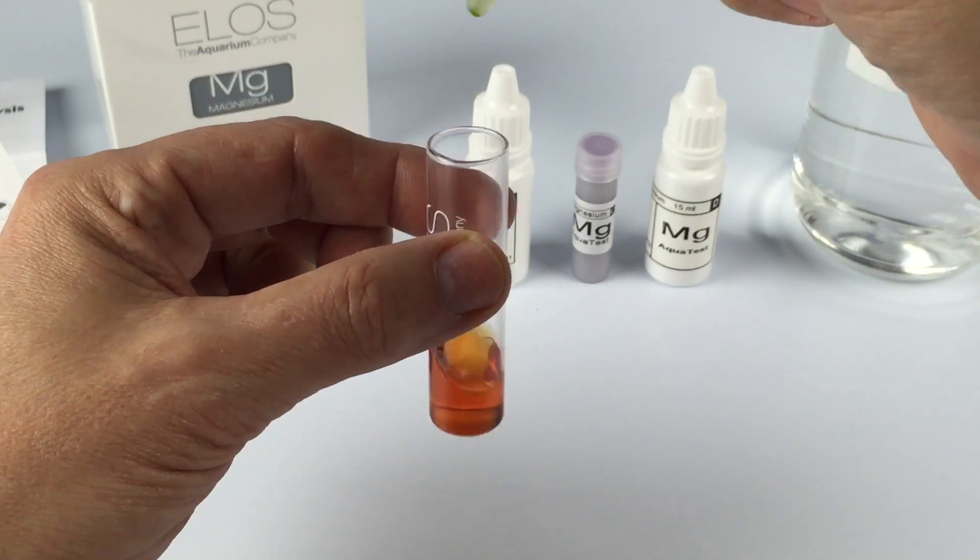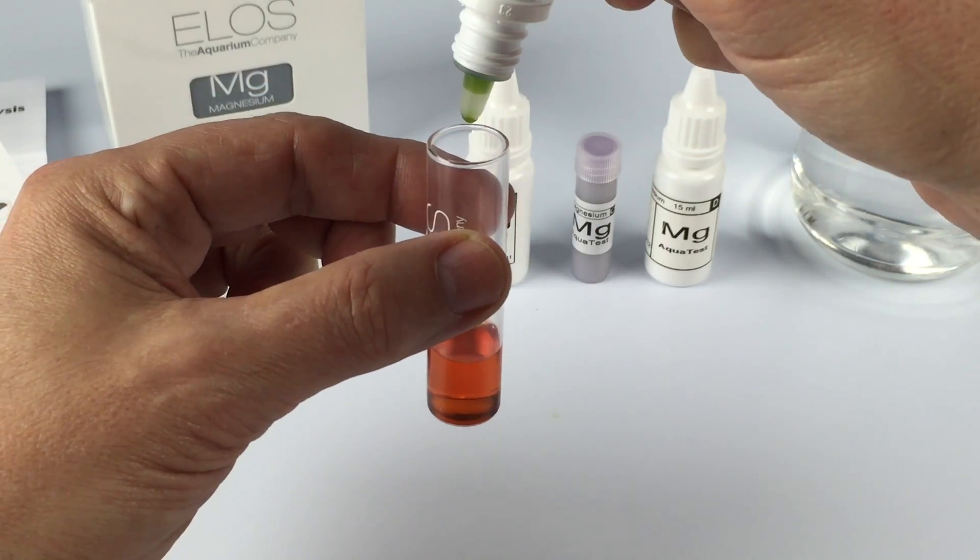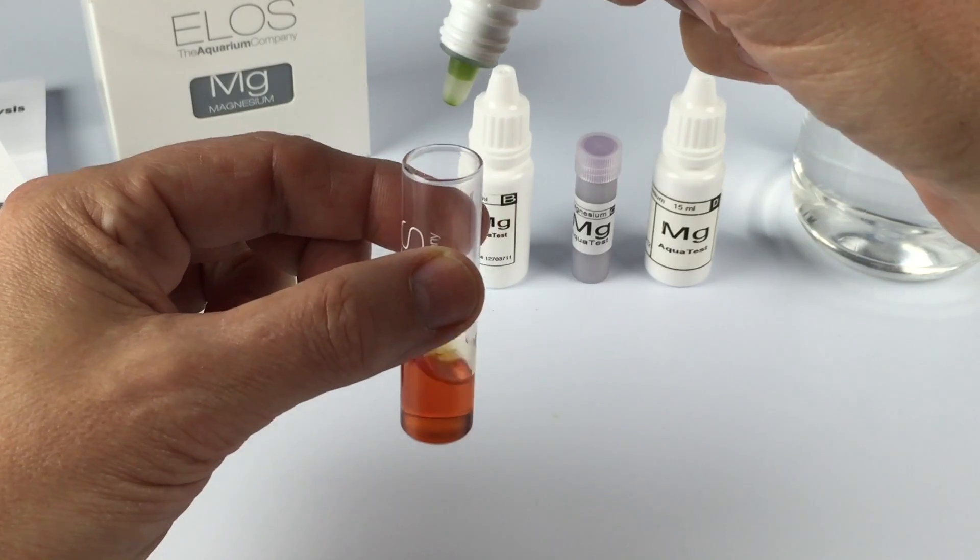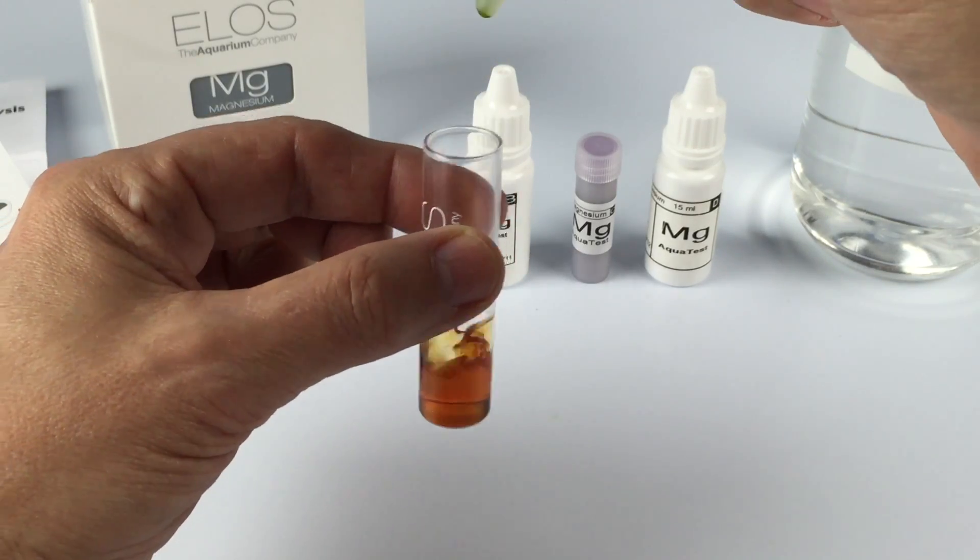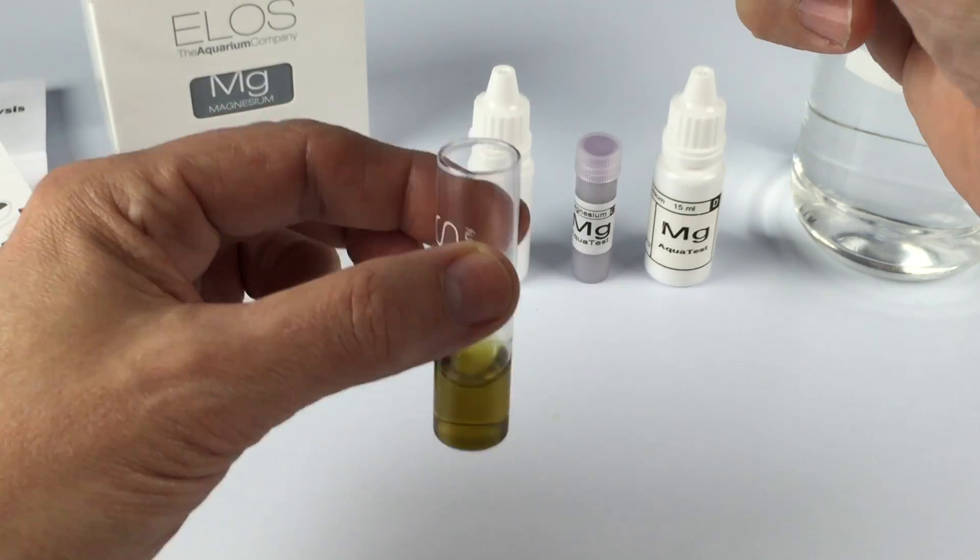Jumping ahead because you don't need to watch me add every single drop. I finally hit the green color when I had put 29 drops in this vial. This part of the test is done.